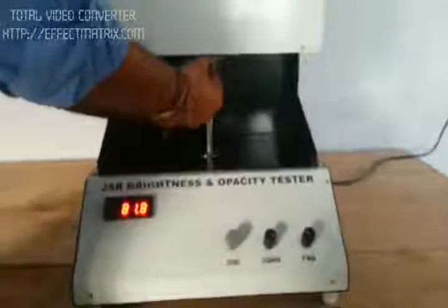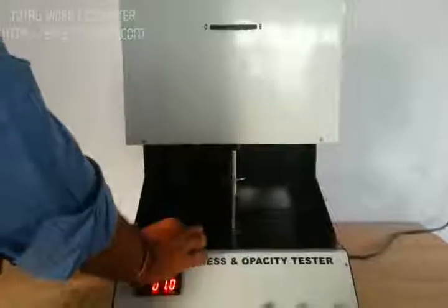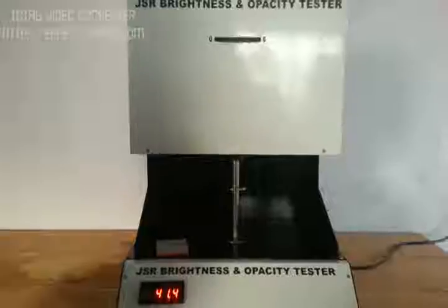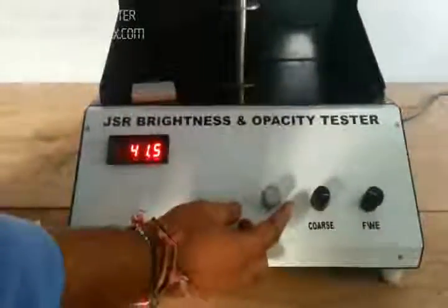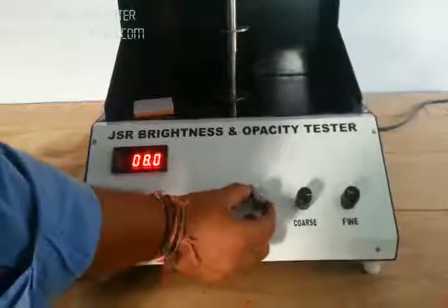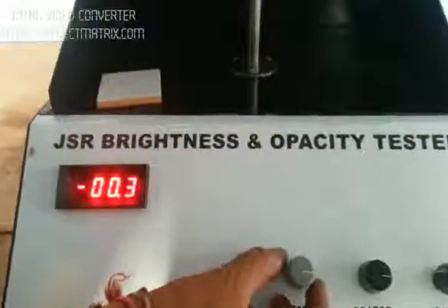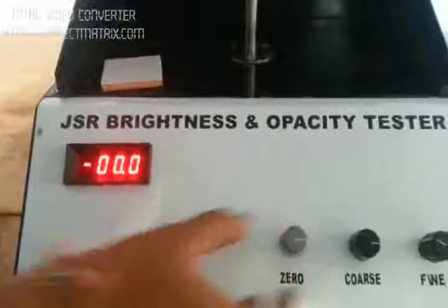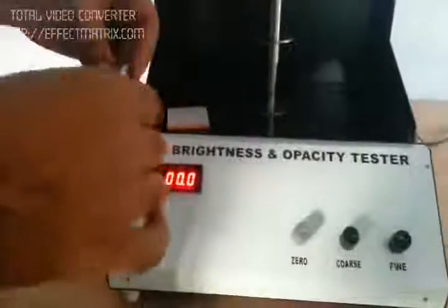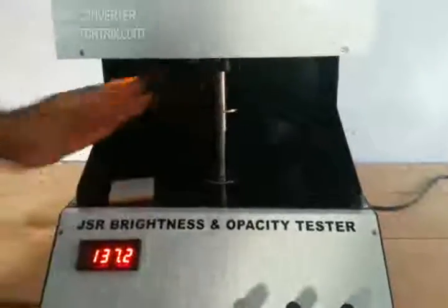Now we will check how to measure the opacity of a sample. For opacity measurement, we select the filter towards opacity. Now the opacity filter is selected. We then make the reading zero using the zero knob.